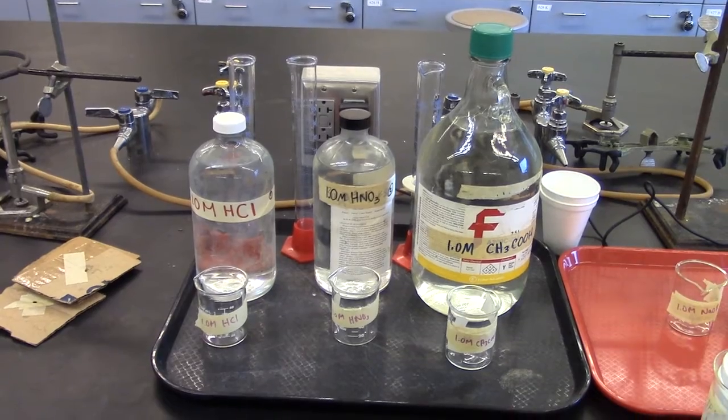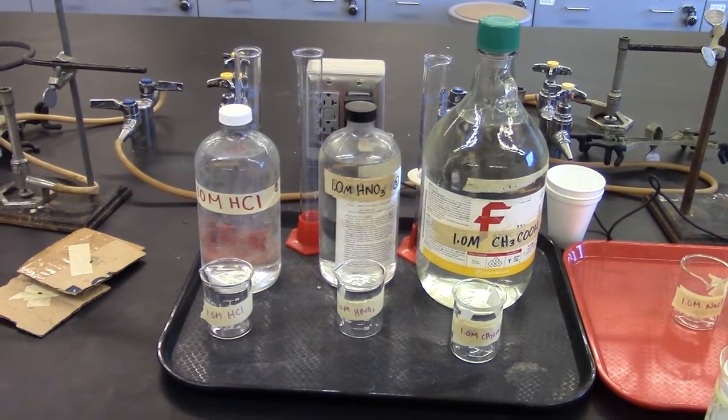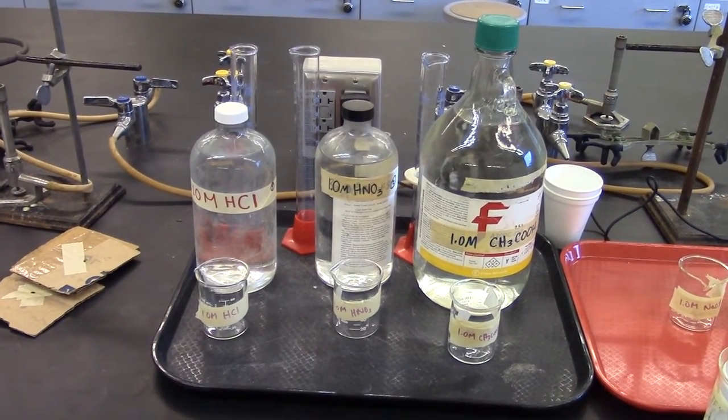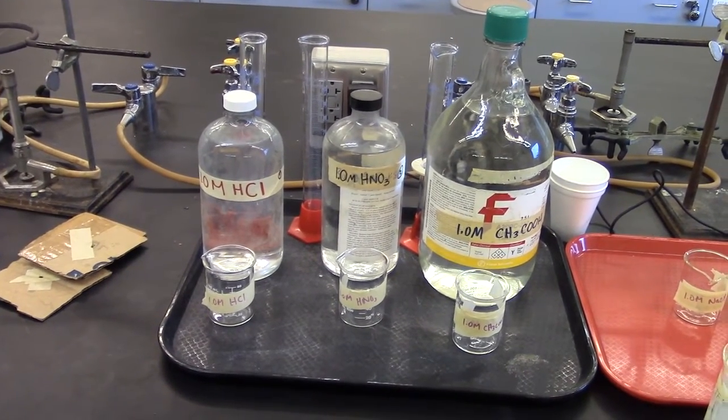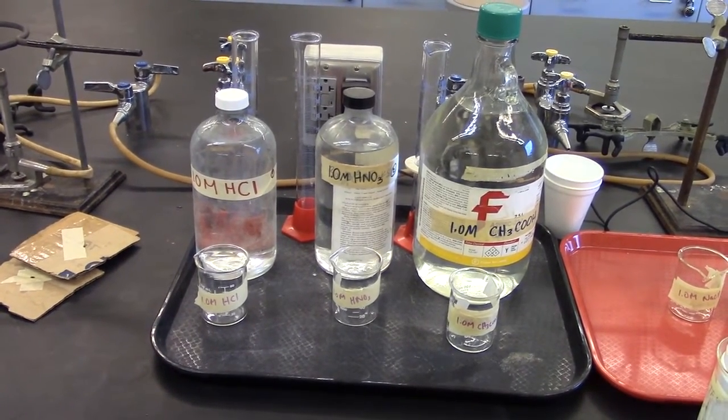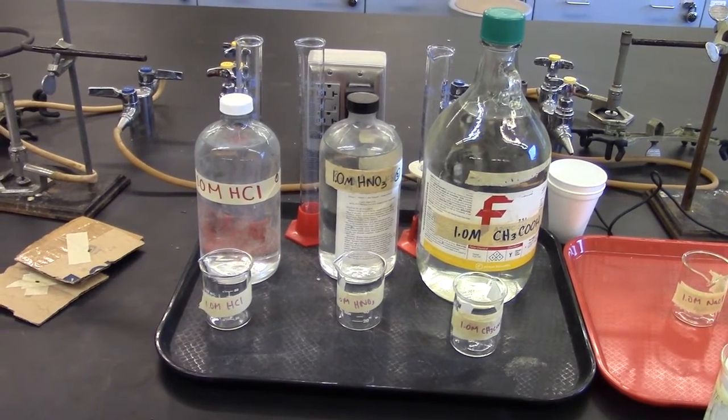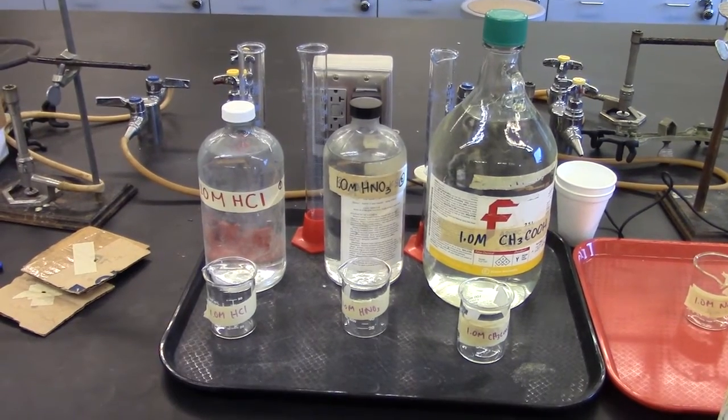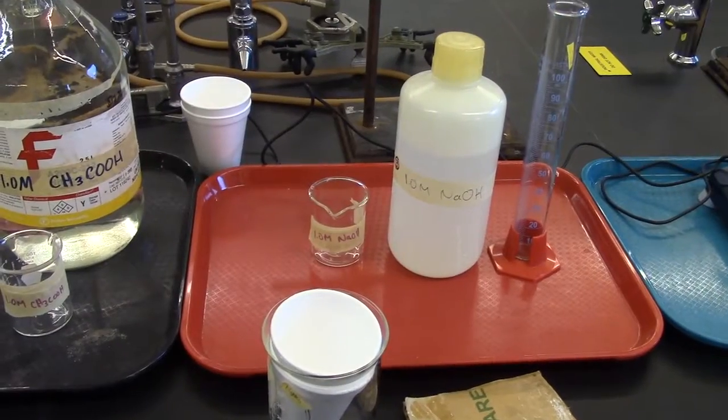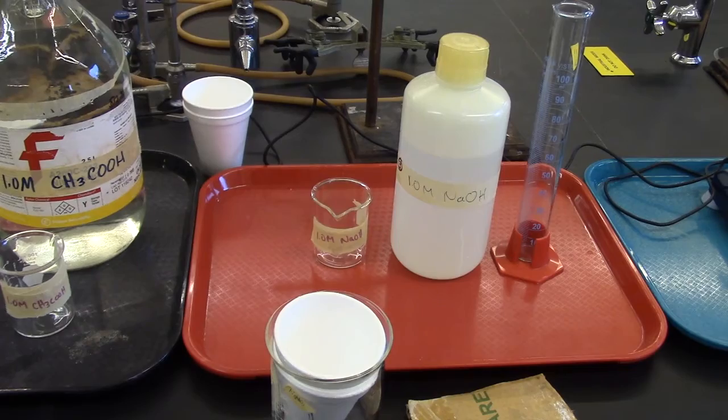We will be studying the neutralization of a strong acid and weak acid with sodium hydroxide. The strong acids are hydrochloric acid and nitric acid, and the weak acid is acetic acid. The strong base is sodium hydroxide.